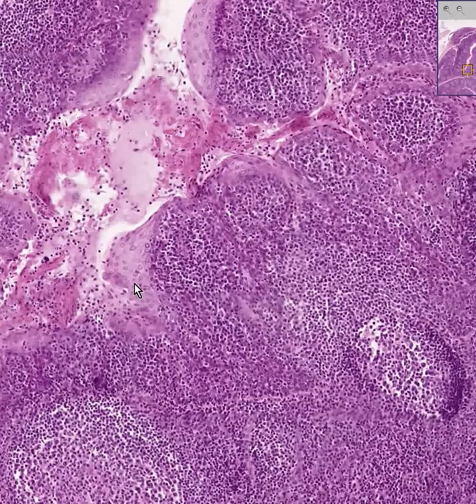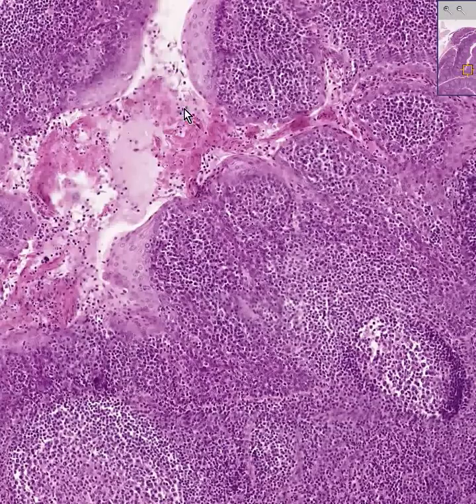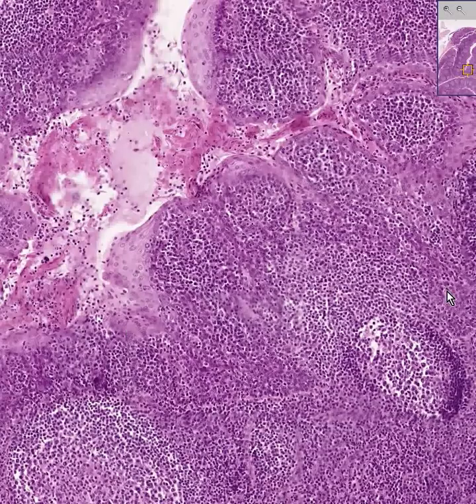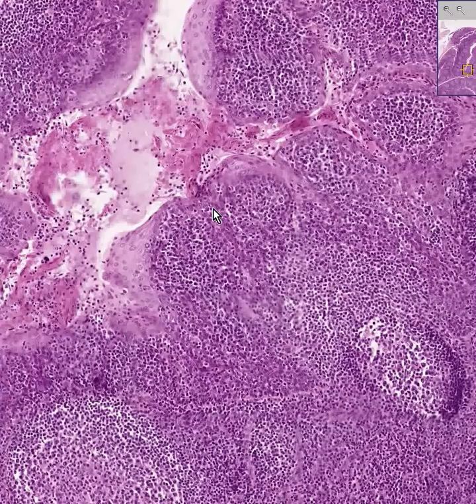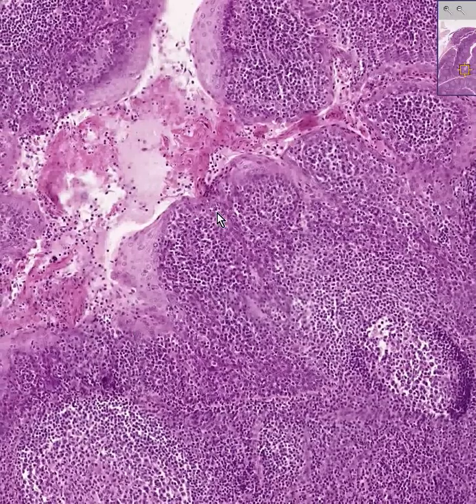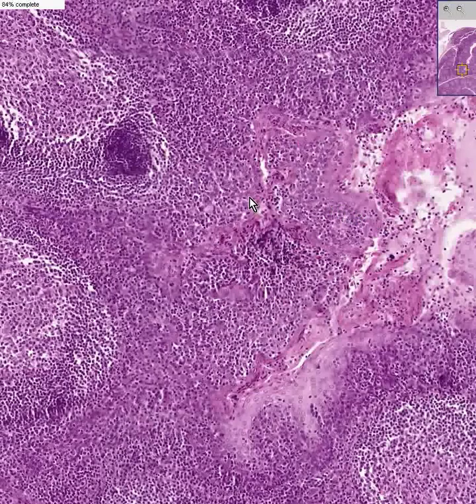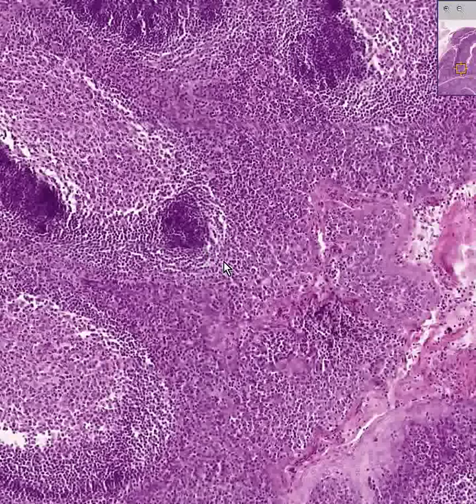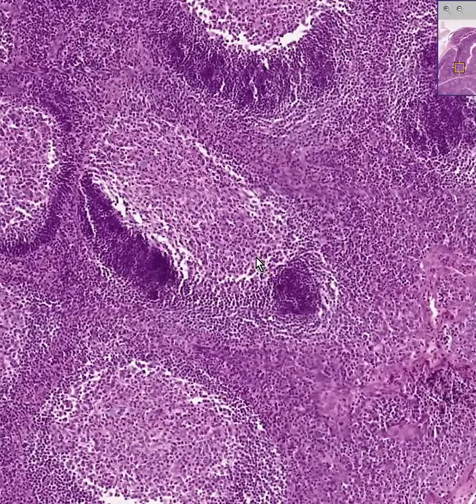Looking at this field, you can identify squamous cells, secondary lymphoid follicles, and germinal centers. That is the architecture of a tonsil.